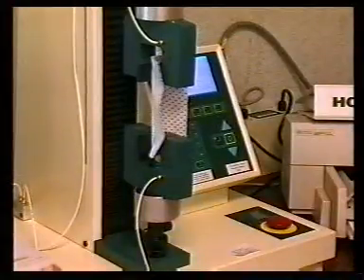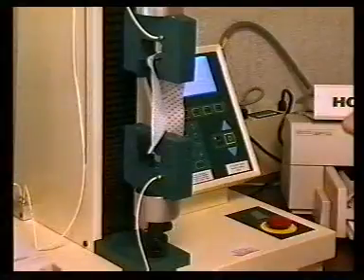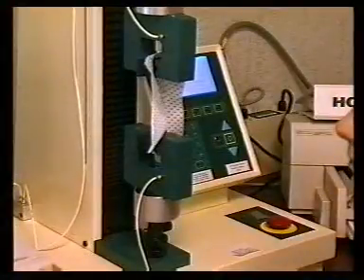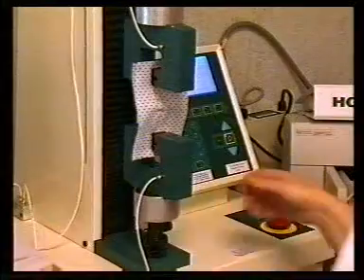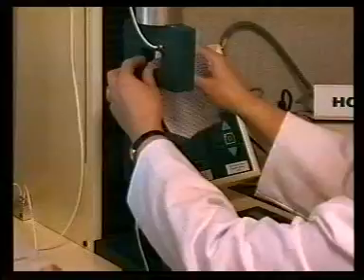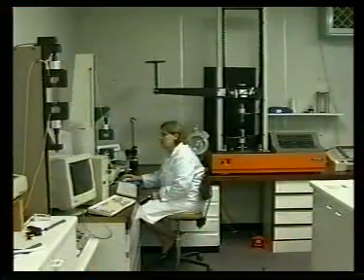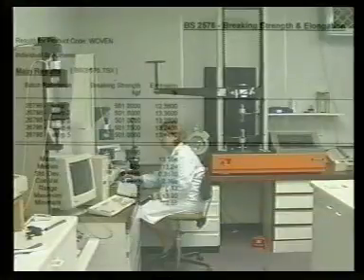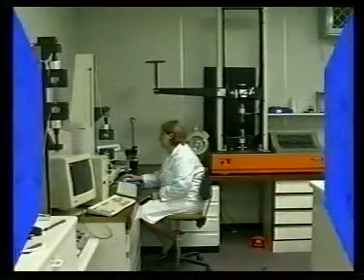The computer will record this data and the specimen may then be removed. The next specimen is mounted as before. This process is continued until all the specimens have been tested. The computer is then set to print out the test results.